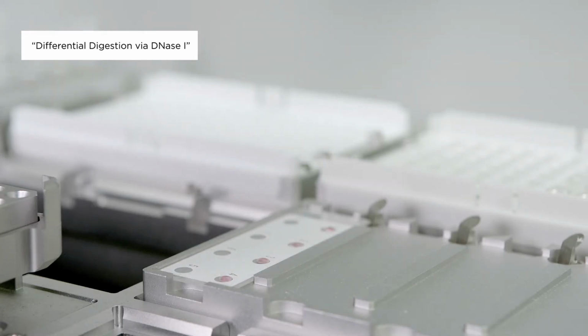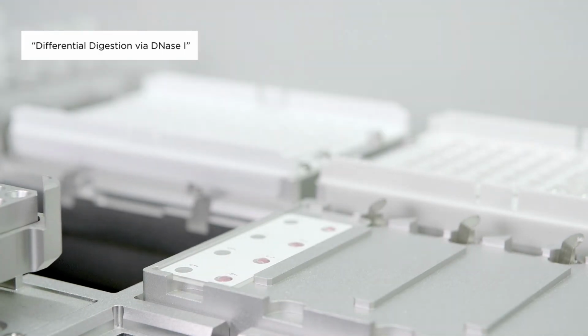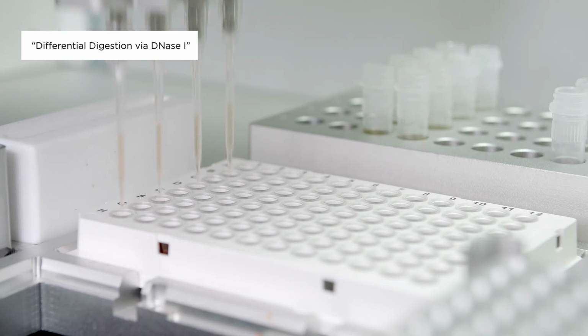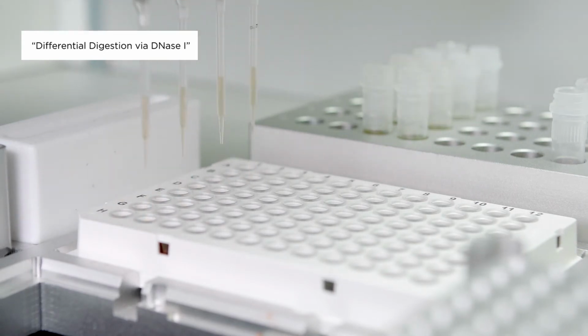Aurora's platform has made it possible to be integrated into whatever differential you currently have employed and validated. Adapters for Promega's Maxwell and QIAGEN's EZ1 mean the instrument can directly load into your downstream extraction, consolidating multiple workflows onto one single platform.